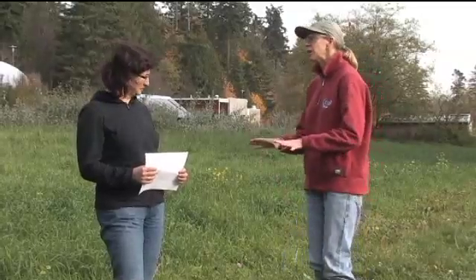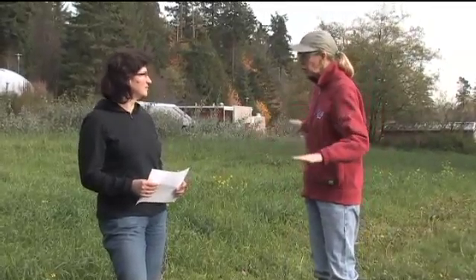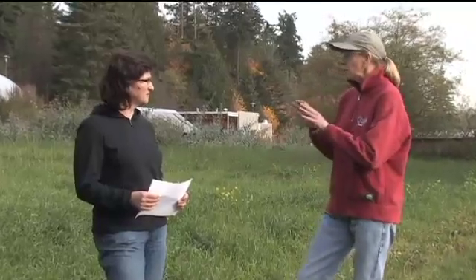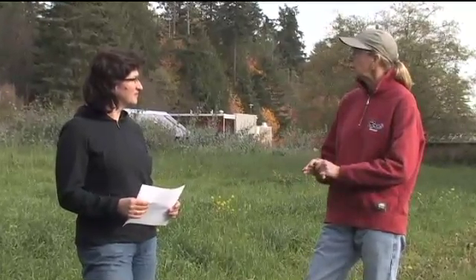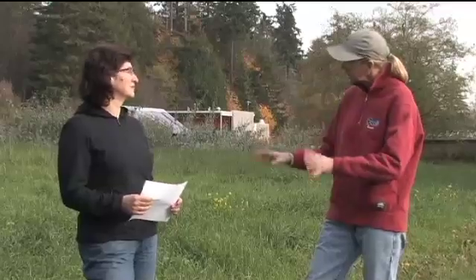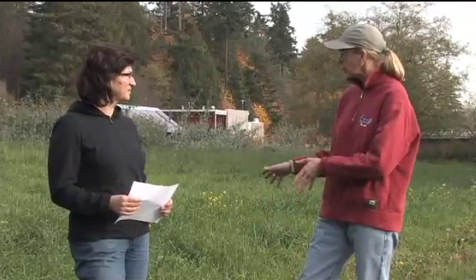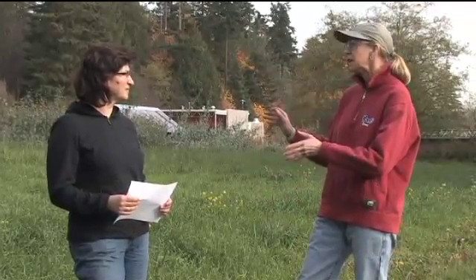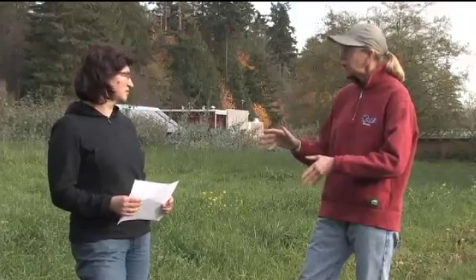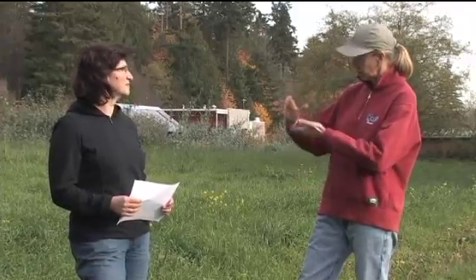So that's simple. We don't need to separate the field for different conditions. We can treat it all as one piece and we want to get a general idea of what the soil nutrients are throughout the field. And because this is a grass crop, rooting depth is about 15 centimeters, so we'll focus our sampling on the top 15 centimeters.